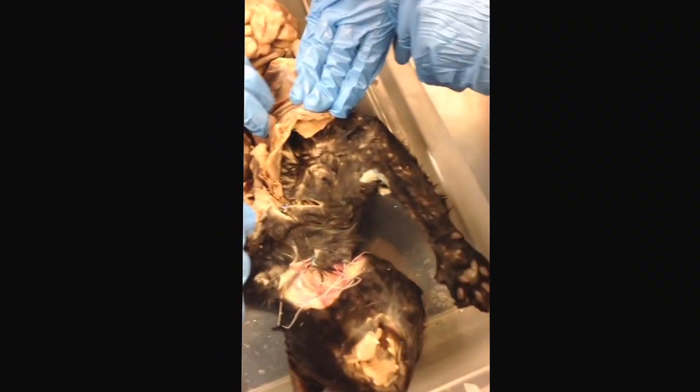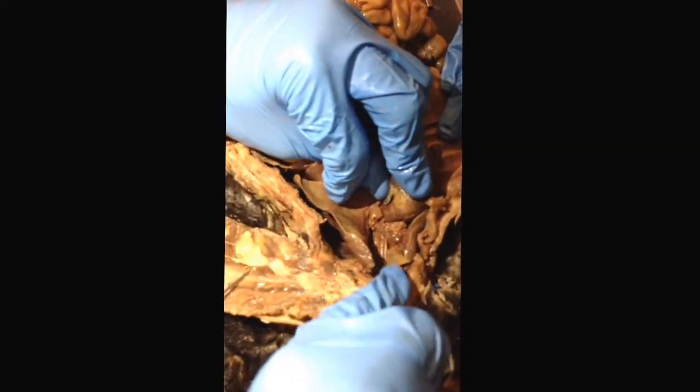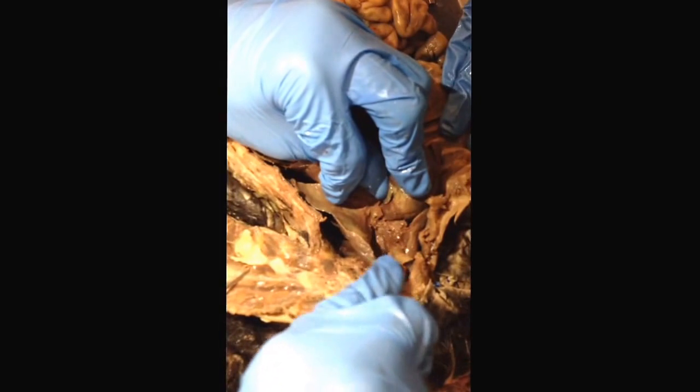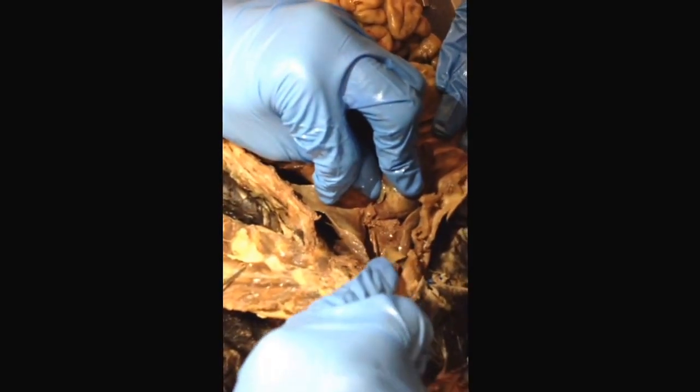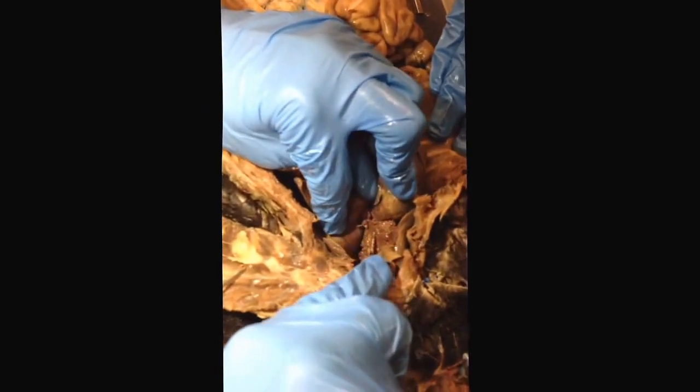Next thing on the list is the aortic arch, which is a little bit harder to see on the organism, but it's where the pulmonary trunk combines with the heart. Is that correct? It attaches to the heart, and the aortic arch is the major artery, pretty much. It's where the pulmonary trunk combines with other arteries and then connects to the descending aorta. Yeah. Okay. Cool. Sounds good.